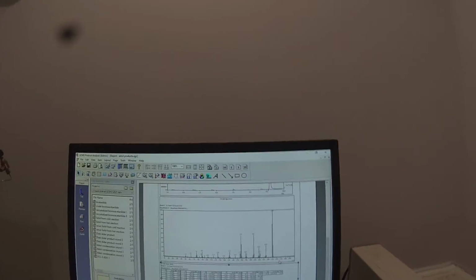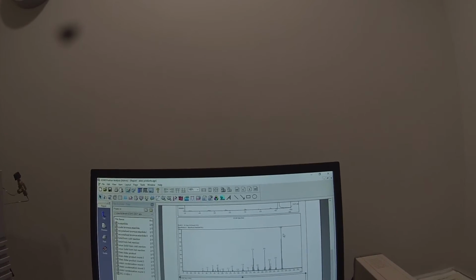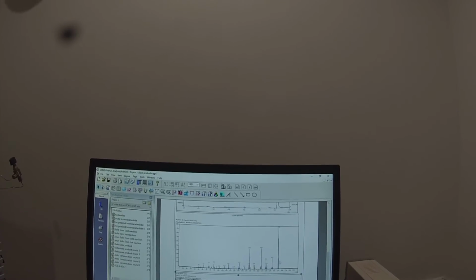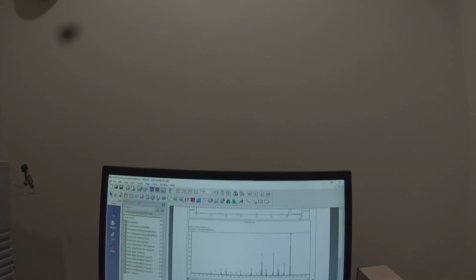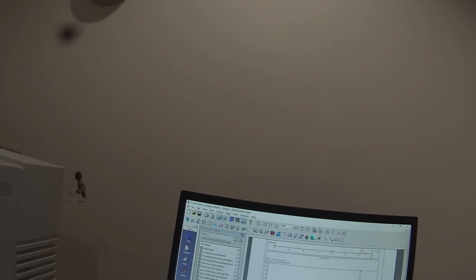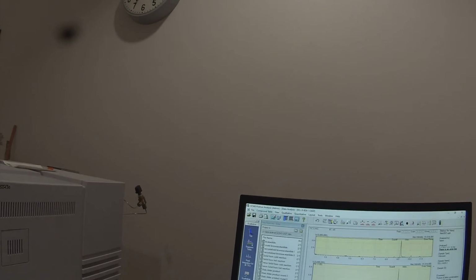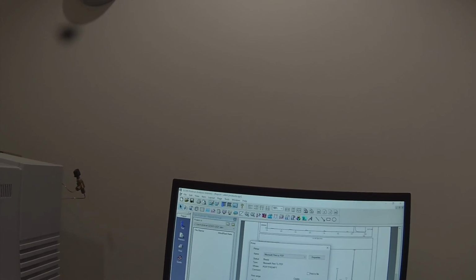Which is an M+2 peak, which you sometimes see with low intensity, with a really intense peak for molecules with a large number of carbons, because you might have 2 carbon 13s in there at the same time. The M+1 peak is typically about 10% of the intensity of the molecular ion, if you have 10 carbons, because of the natural abundance. So I'm going to save that report format file. I'm going to save the data file. And then we will print that report to a PDF file.